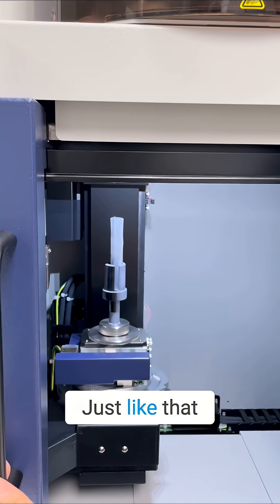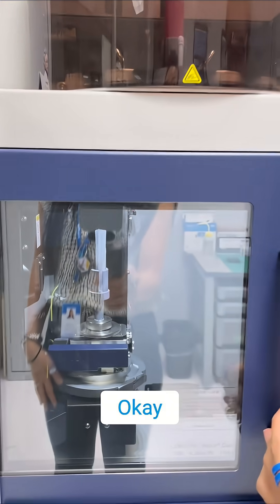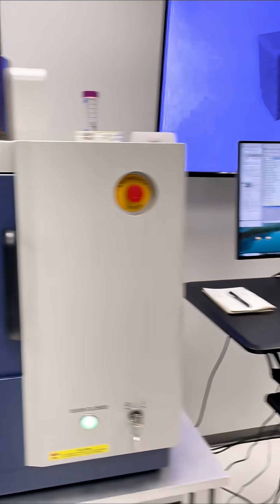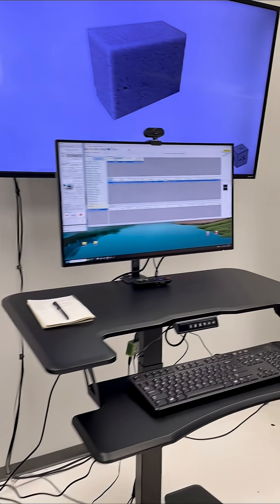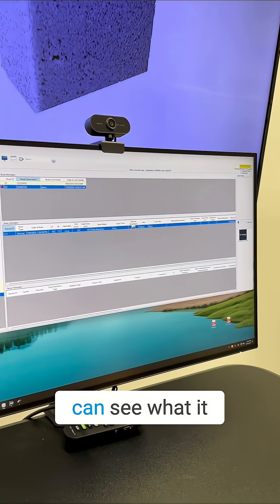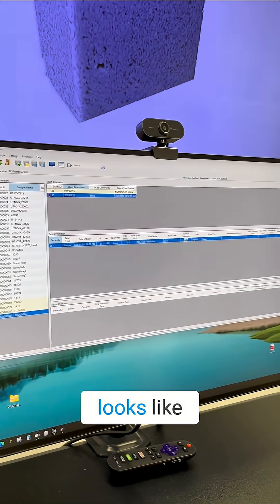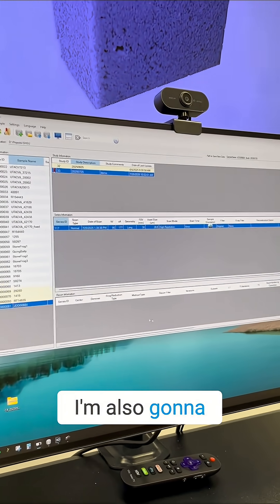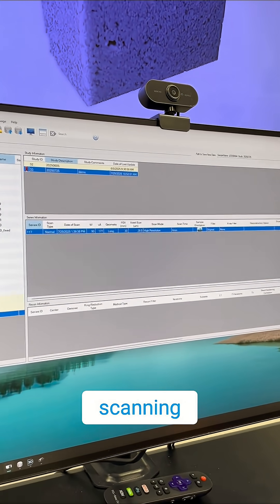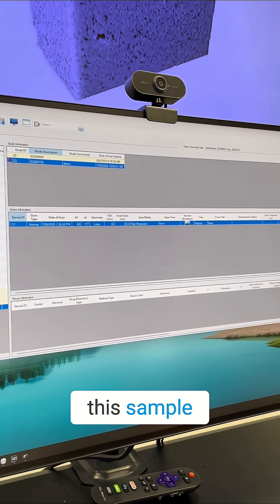Just like that, and we're ready to go. While I'm turning the X-ray on so you can see what it looks like, I'm also going to talk about why we're scanning this sample.